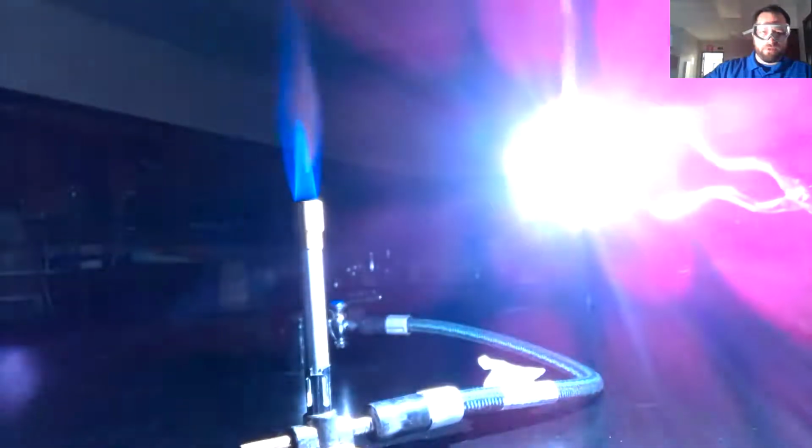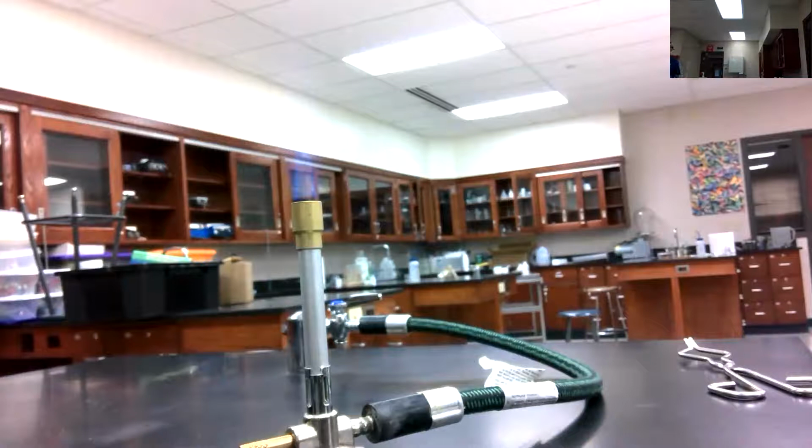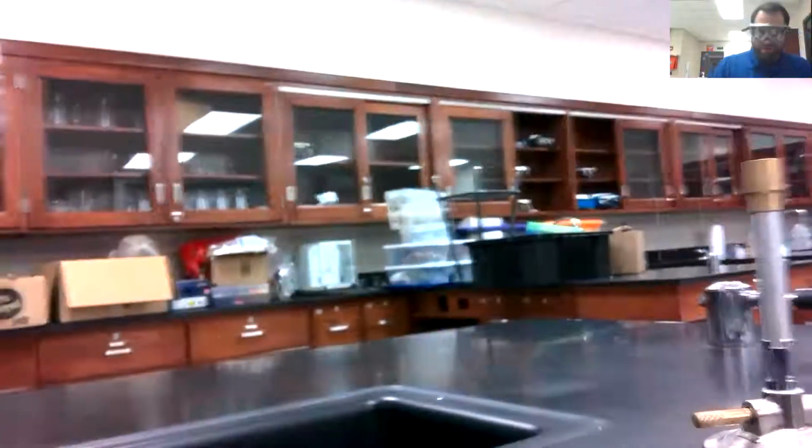There you go. I'm holding on to this magnesium, and there we go. That was it. That was the reaction. What did you see for that one? That was pretty cool, huh? All right, that quickly our lab came to a close, huh?